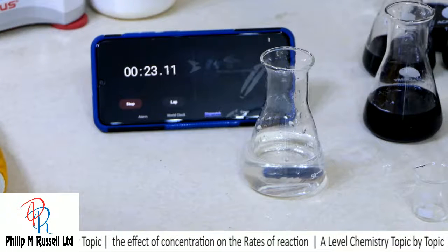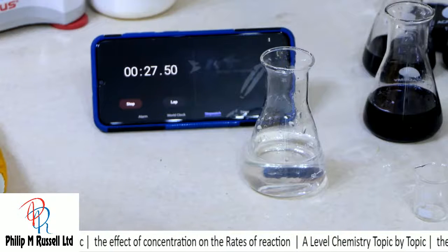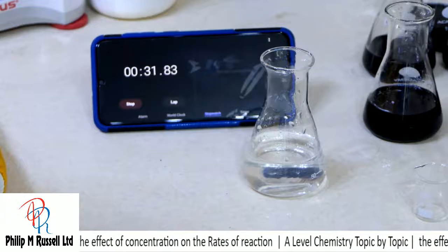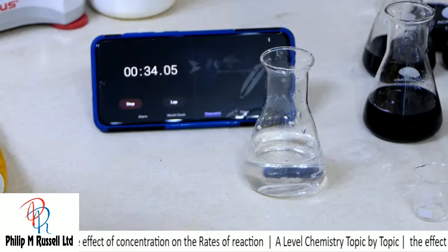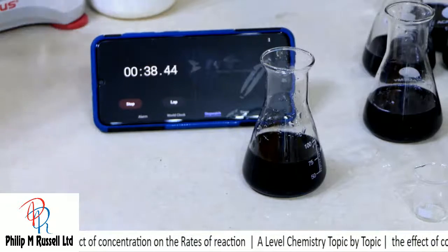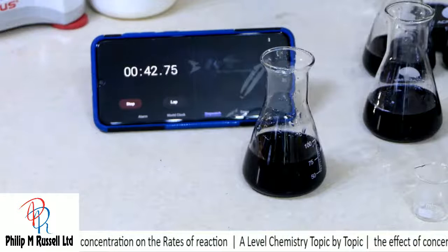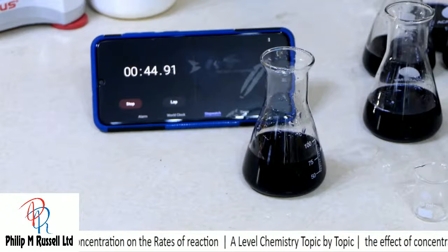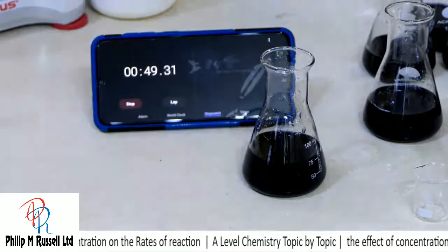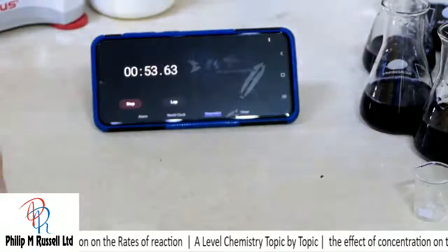So there's our 23 seconds gone. Will it go at 33, do you think? No, it's 1 over T. So there we are, about 35, 36 seconds. And I really could do with doing this once more.